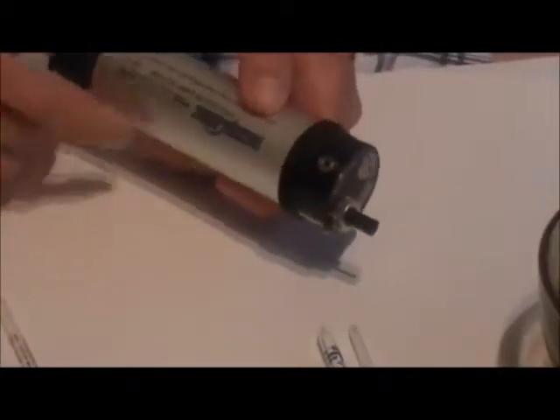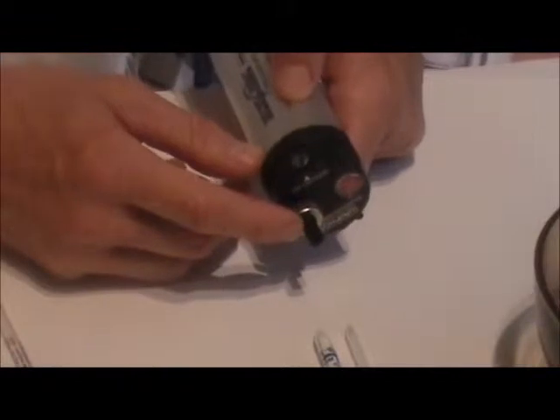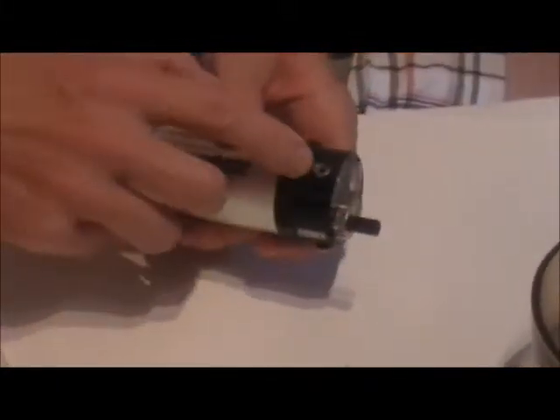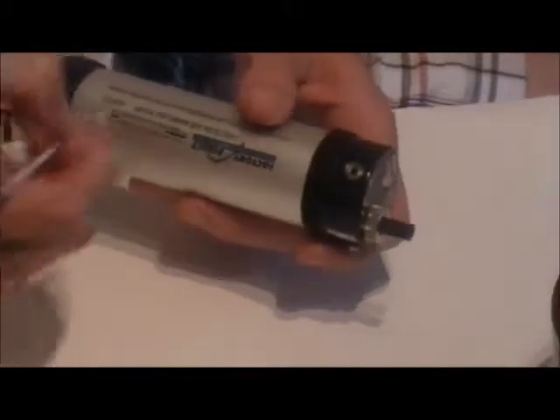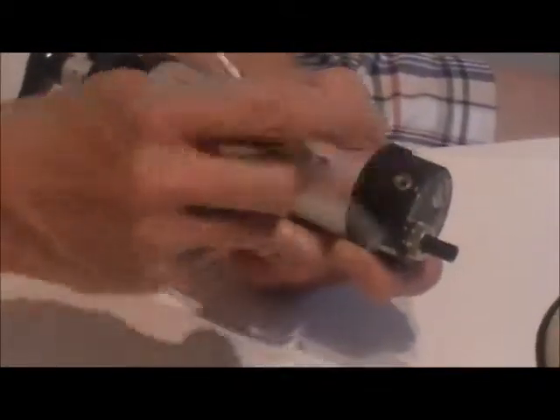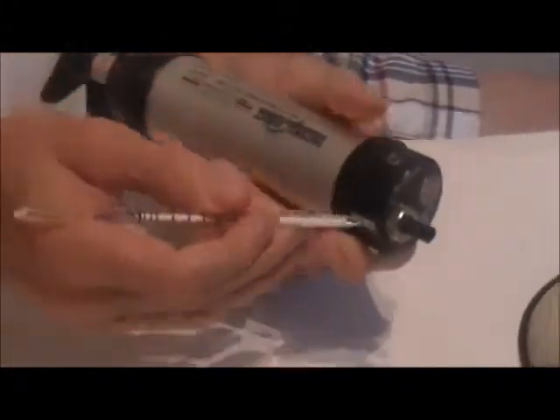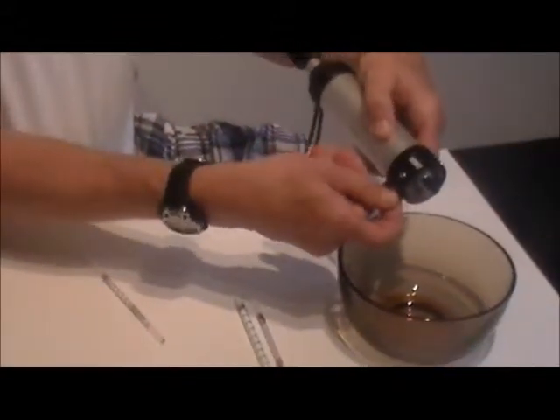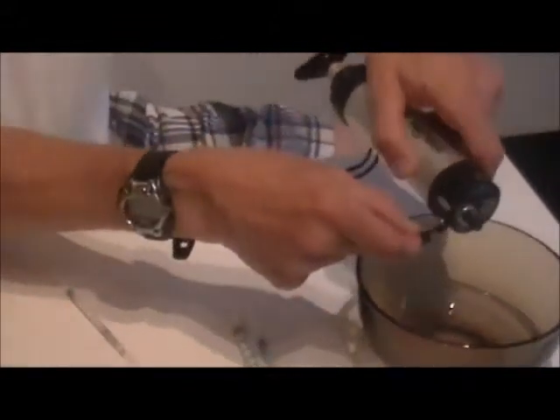Note that the pump has a few special features. The rubber inlet is designed to accommodate tubes of different diameters and still make a good seal. On the head of the pump is a tube tip breaker used to open the glass tubes. The tips are collected in a reservoir which can be emptied as it fills up by using the rubber cap on the other side.